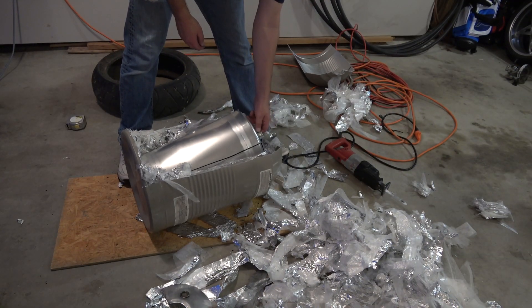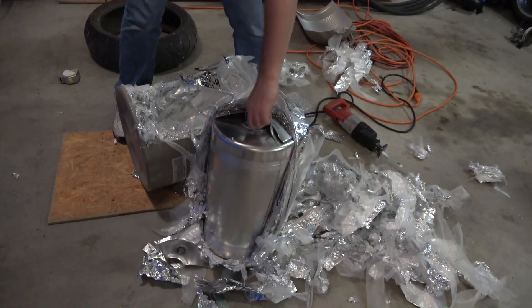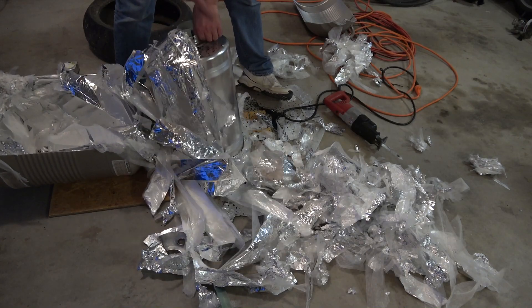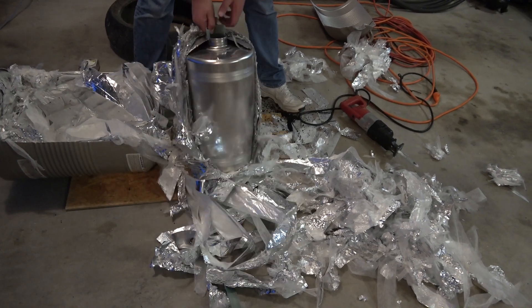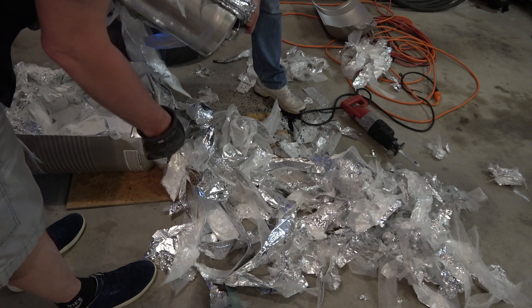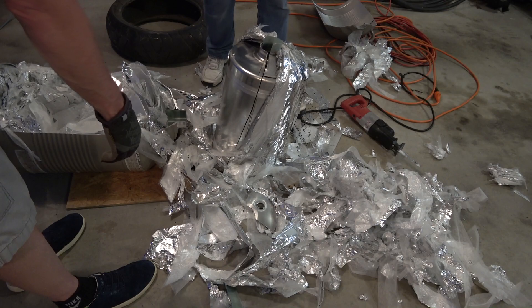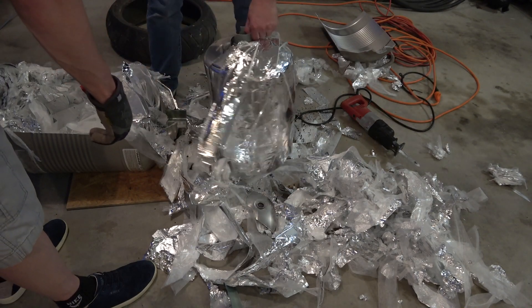Well, it turns out we don't have to cut the bottom — we just cut the neck and it comes out. So here is that multi-layer insulation. That's kind of clever. And we lost all of our charcoal. There must have been a charcoal filter here, underneath the top ring. That makes sense. When we took this piece off — there's a filter. So obviously there was a moisture filter here. Charcoal acts as the vent, and it probably corresponded with that outside vent piece on the other side. More insulation.